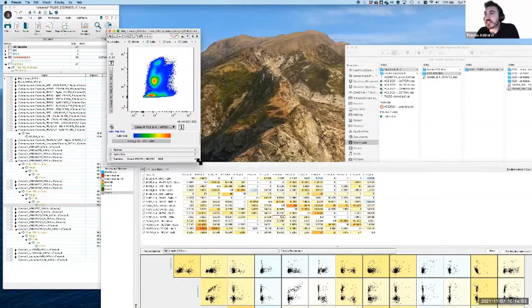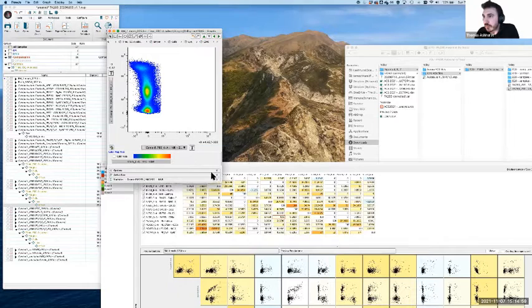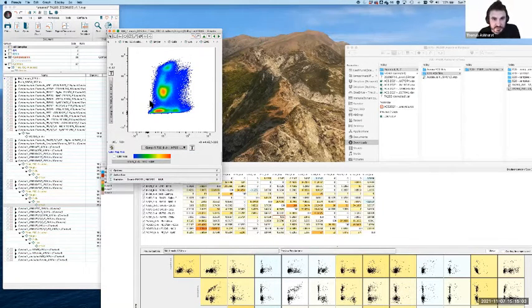In this case, this is Ly6C versus CD45. One might look at this and think, actually, there is a bit of a lean to that, as it's going up, it is leaning over to the right a little bit. But if we consider what's actually happening here, CD45 is going to be highly expressed on all of our immune cells. And this is actually going to lean in this case because these two markers are highly correlated.